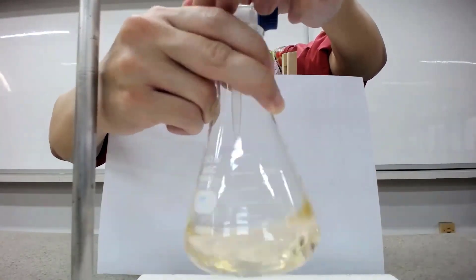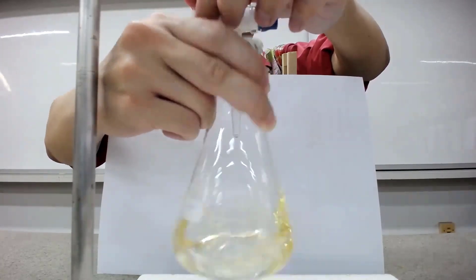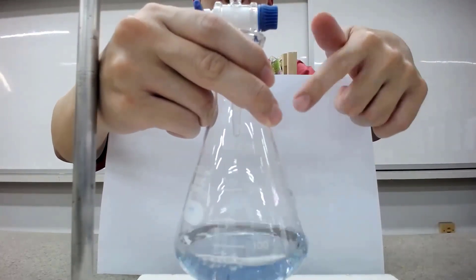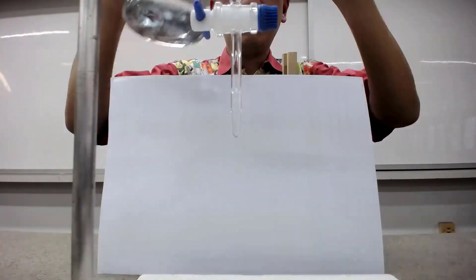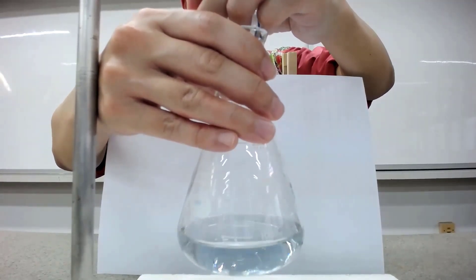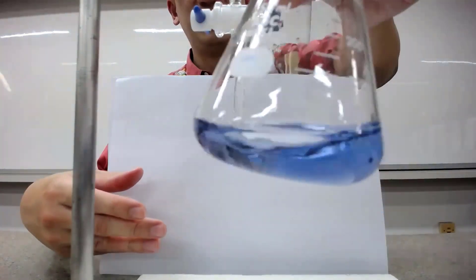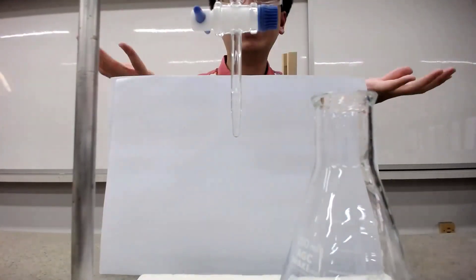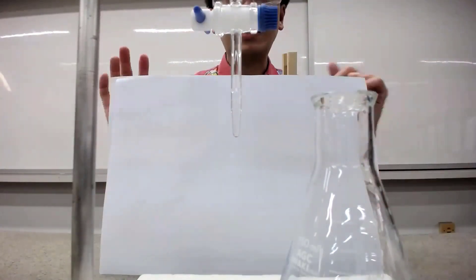So very, very carefully, you add drop-wise. You can slow down the addition until you observe that the green is disappearing very slowly. So right now you can stop. This is already overshot by a little bit — this is still okay. This particular color — if you think about it, because if I add in one more drop, the blue will be very intense. I'll just add one more drop for you to take a look. Can you see that this blue is now a lot more intense? So just now that endpoint is actually okay. But if you are not comfortable enough, you can do another titration by simply just reading off and then using that as a rough reading.